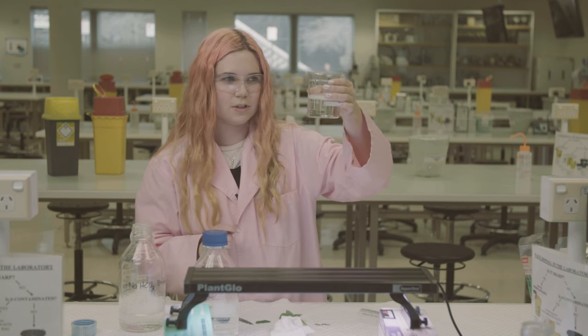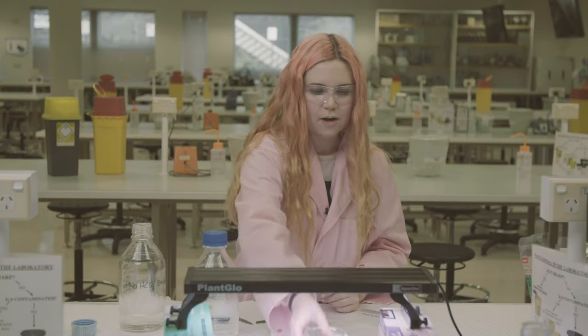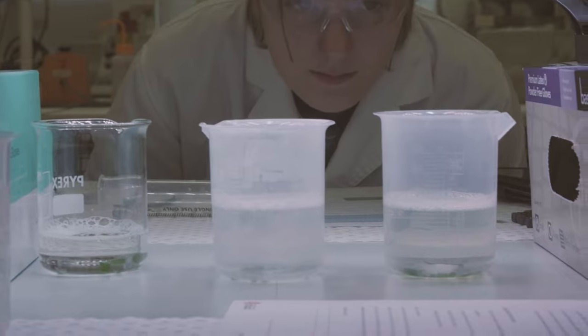Sometimes it's difficult to get them all to sink. Then what we do is put it under a light source and time how long it takes for them to float. I'll just go set up a negative control, and then we can compare them under the light.